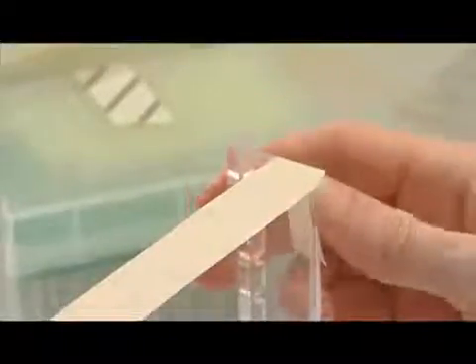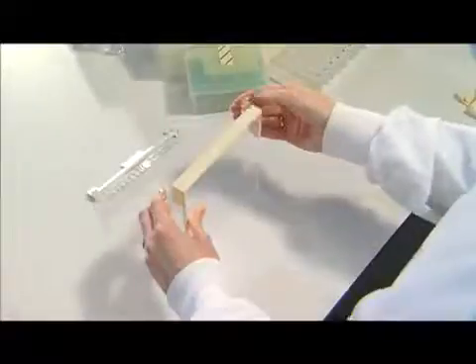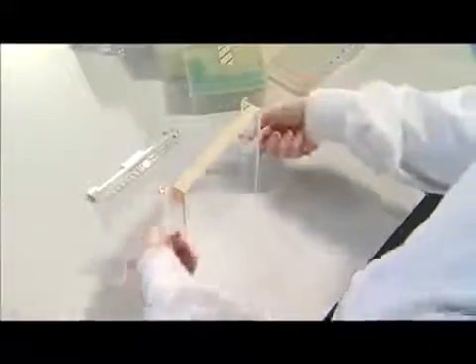Place the tape around the end of the gel tray, overlapping both sides of the tray, and make sure it's firmly stuck along the entire end. Do the same for the remaining open end.